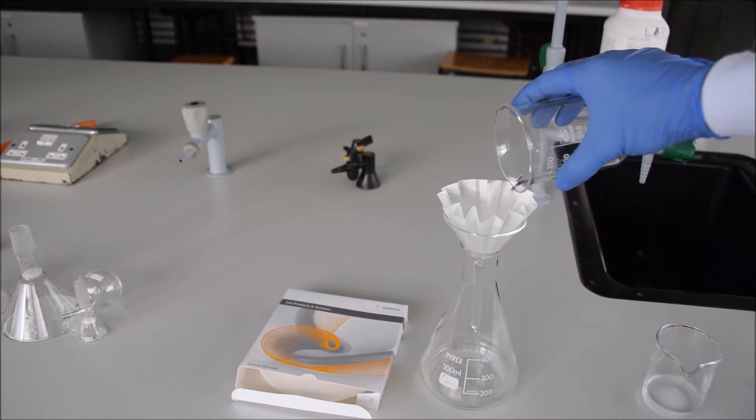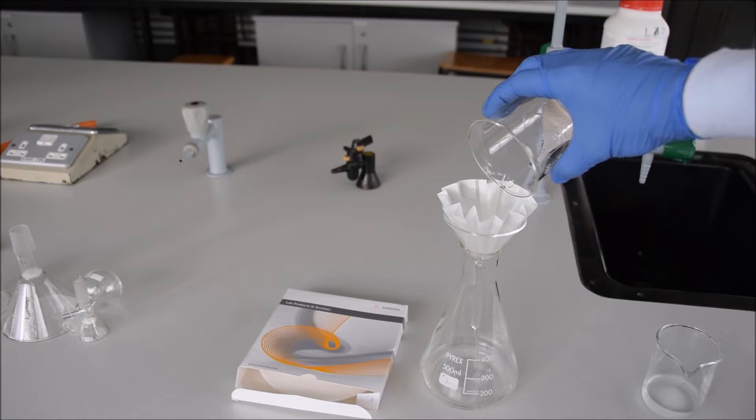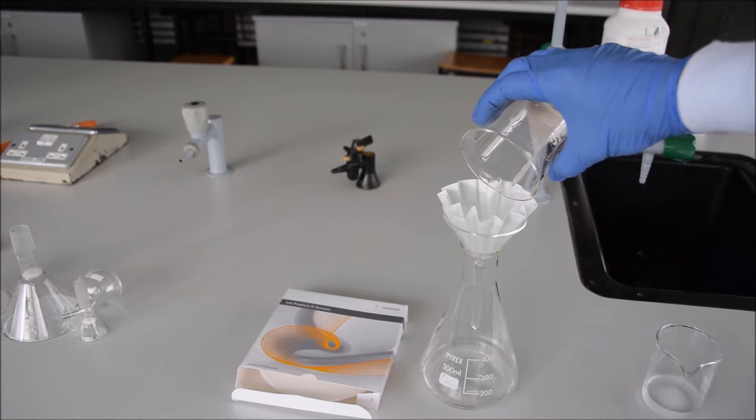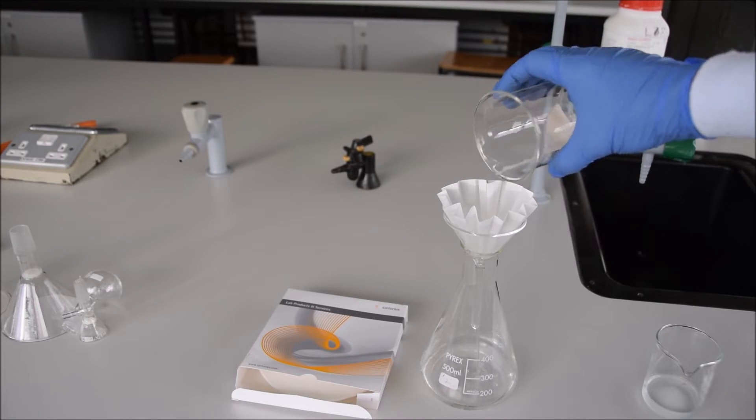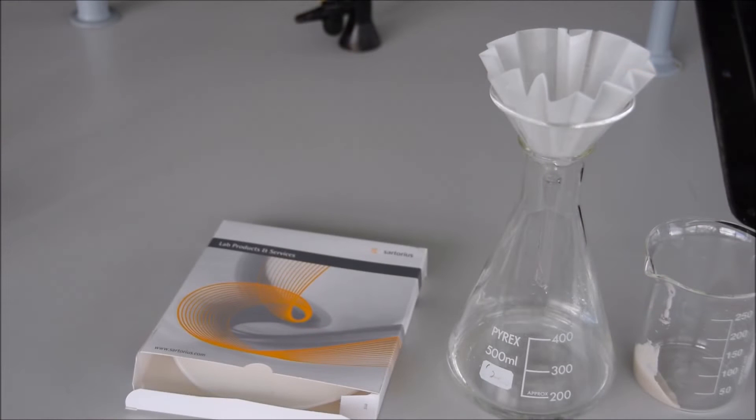You can see here it does a very nice job of filtering and we leave most of the sand behind and the liquid travels very rapidly through the well-fluted filter paper. If you want to see how to flute a filter paper as neatly as that, there's an extra video—follow the link that's coming up now.